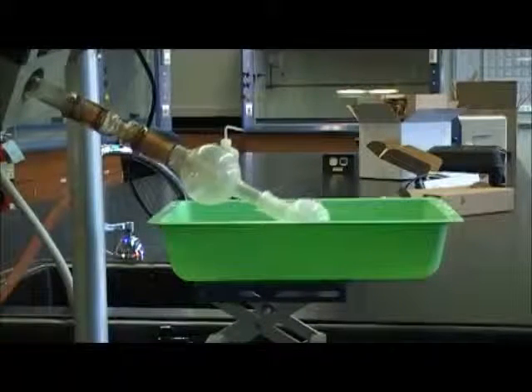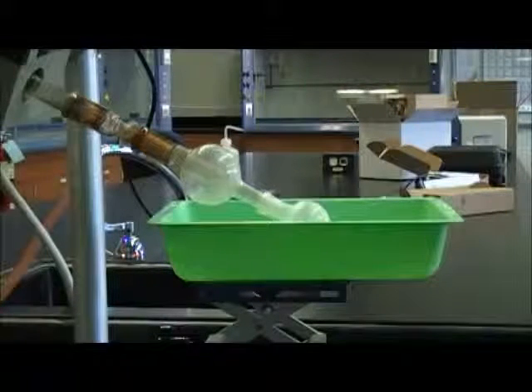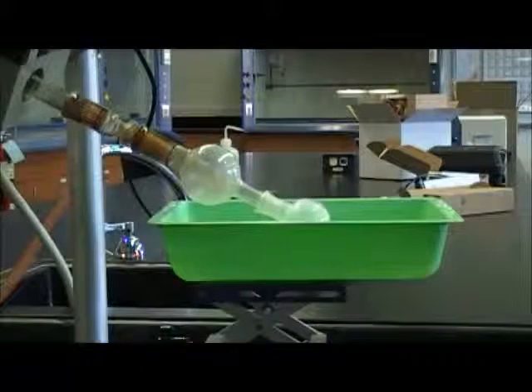My aspirin dissolved pretty well in ether, but as the ether is evaporating, of course, the aspirin is precipitating out. It crystallizes out and forms on the inside of the glass.